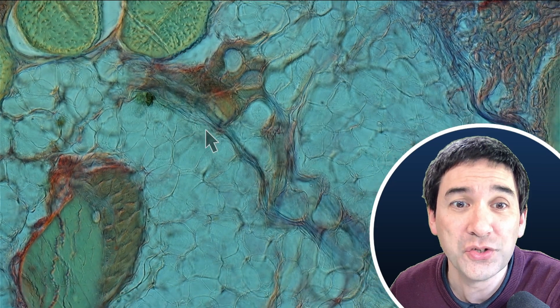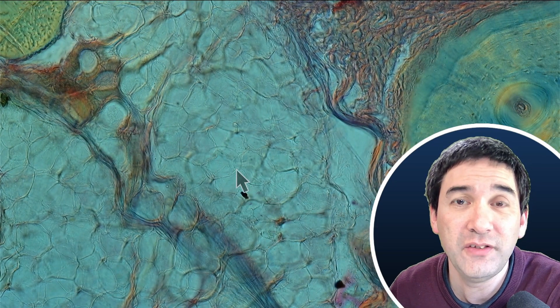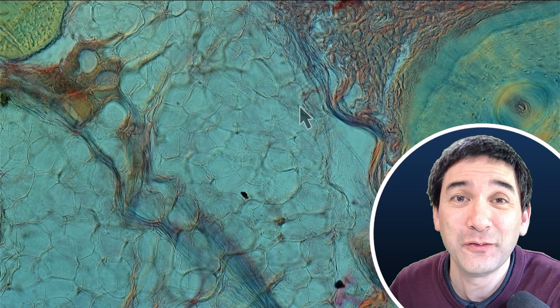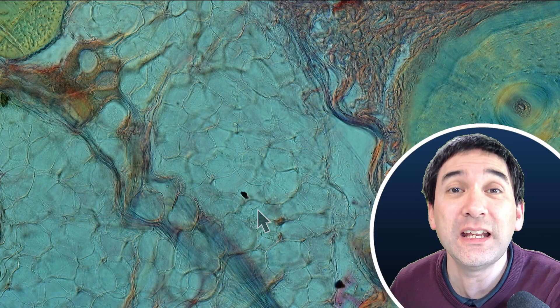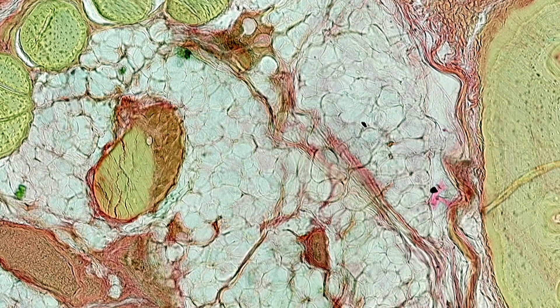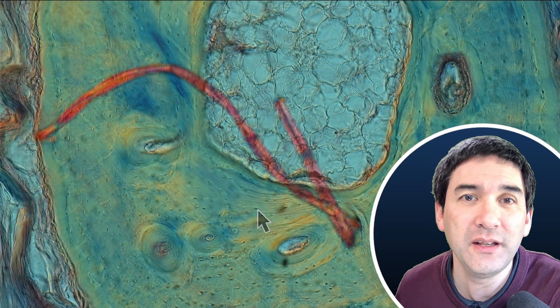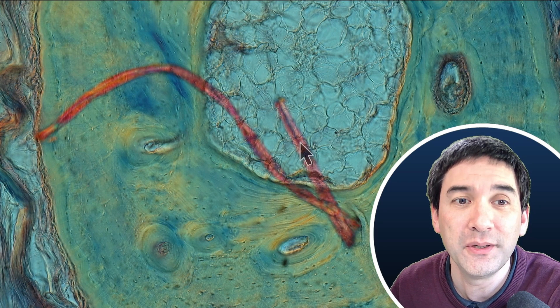What we're also able to see are those white looking structures — these are all the individual cells. This appears to be so-called adipose tissue, and these are fat tissue. It shouldn't be surprising that there is a lot of fat in the tail of a monkey, because fat is not only an important energy storage, but also very important for insulation, heat insulation. Fat is very effective in insulating against the cold. There is actually a contaminant fiber over here that we just ignore.